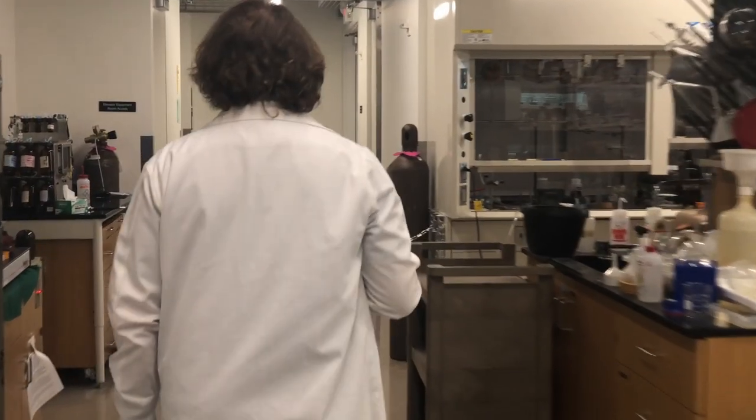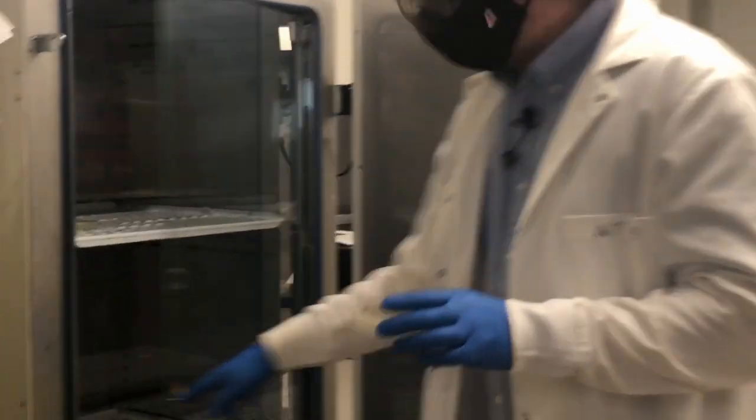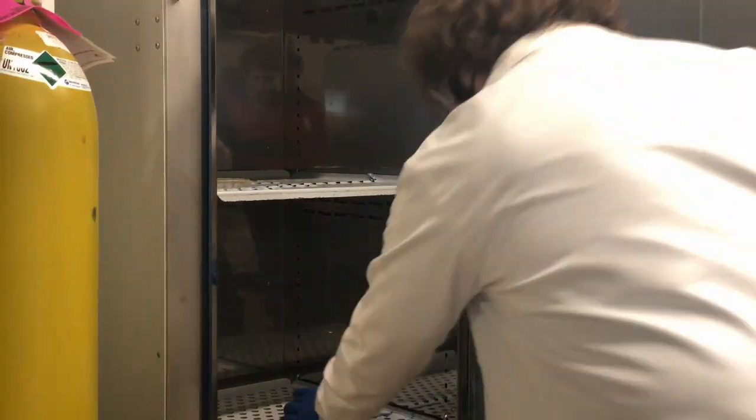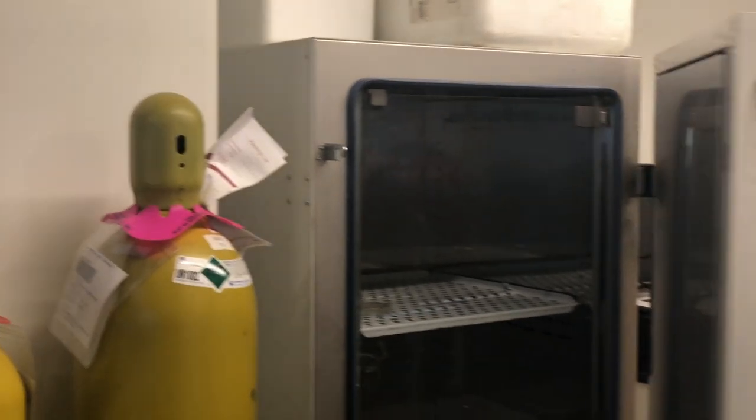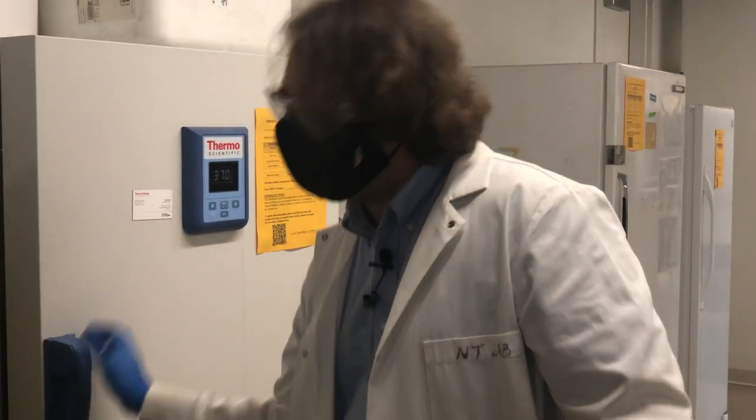Anyway, this is good to go. And it will go into the incubator. So when we put it in the incubator, the only thing to bear in mind is that it should go upside down so that any condensation that forms in there isn't going to drip down onto your bacterial colonies and spread them out. What we're going to do is leave that overnight and check it tomorrow morning.